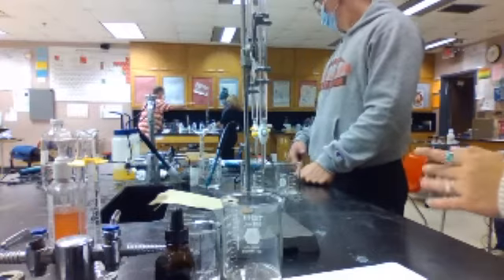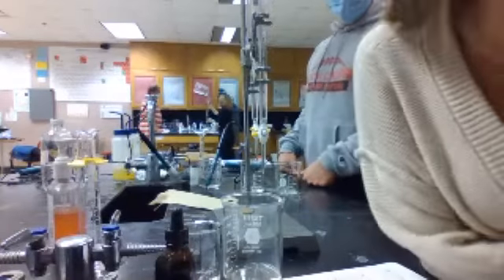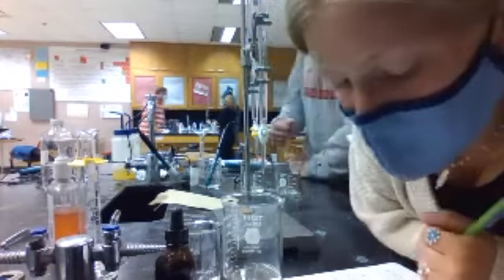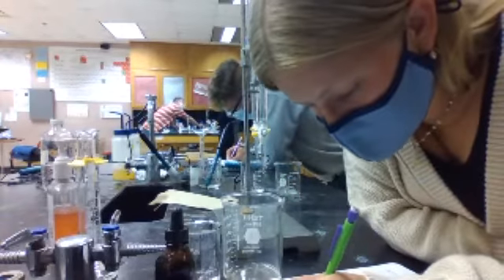So we have these initials. So should we know what the final volume is for the acid? Oh yeah, sorry. Okay, so for that, it looks like 19.98. Yeah. Okay, so for the final volume of the acid, it's 19.98, because that's when we drained 10 milliliters of this and put it in. If that makes sense.